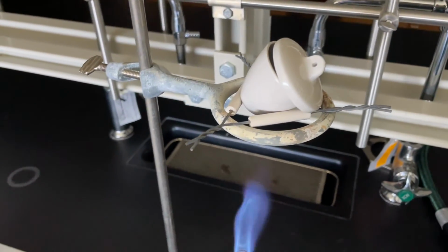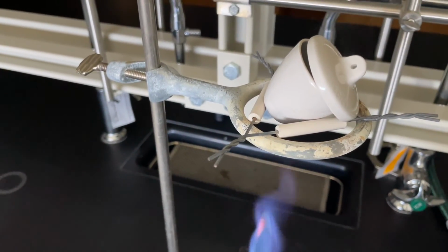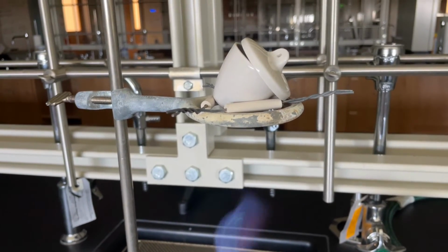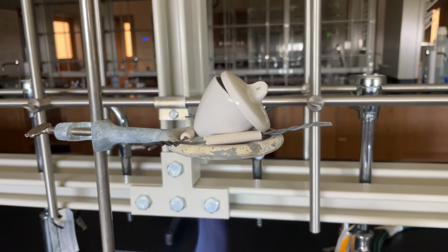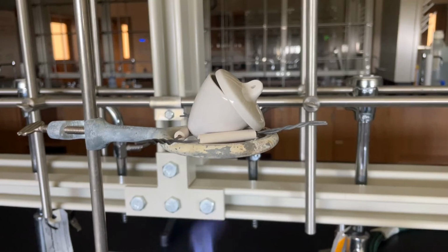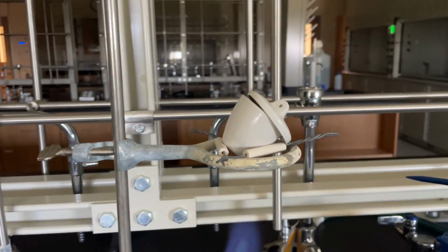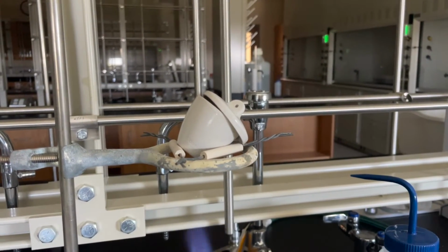We could have gotten the crucible perhaps a little bit closer to the inner cone of our flame, but we wanted to control the heat here because whenever it's in a liquid form, it's similar to boiling pasta. It can potentially boil over, and if it boils over, we're going to lose part of our salt sample, and we don't want to do that. So we're controlling our boil here, controlling our steam here, and instead choosing to let it cook longer.